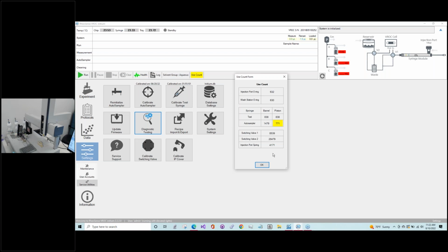Because we're actually going to demonstrate changing of the syringes, the test and auto sampler syringe, I'm going to switch for a moment to switch valves. Switch valves are something that you will need support from our field service engineers in terms of changing out when it's necessary. But one of the improvements we made for OnePlus over Model 1 is that these switch valves have been redesigned so that they do last longer. And so the chances of them actually failing in the short term is quite low.